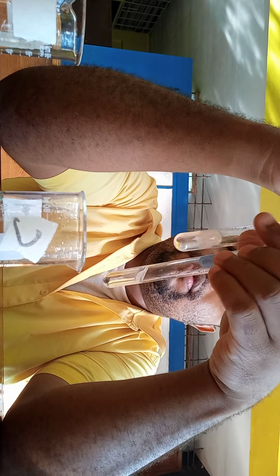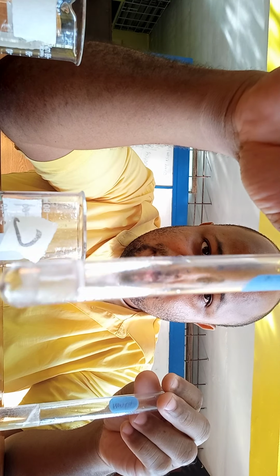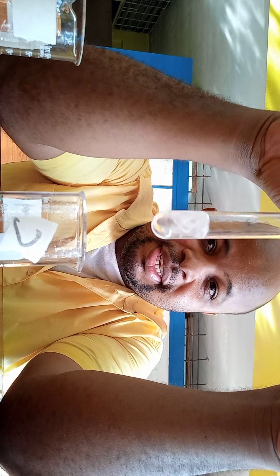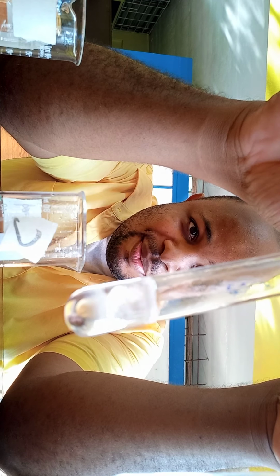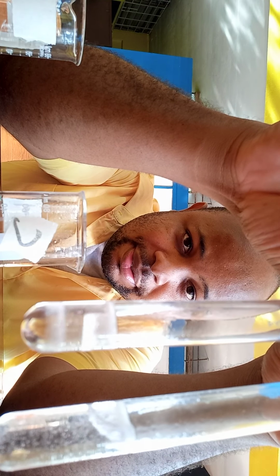This one is test tube C, which was the 1-propanol, but this one is test tube A, the 2-propanol. And if you notice, the 2-propanol one, which would now be propanone, the ketone, this is just the alcohol and the acid, right? So that is what I was saying. This reaction that is going on in this one would have been with any sulfuric acid remaining. And as you can see, both of them are reacting similarly.